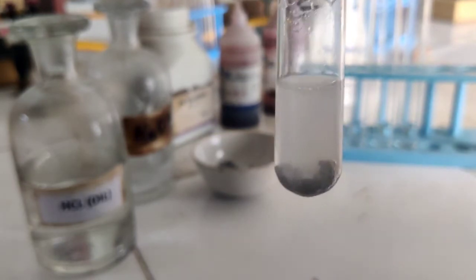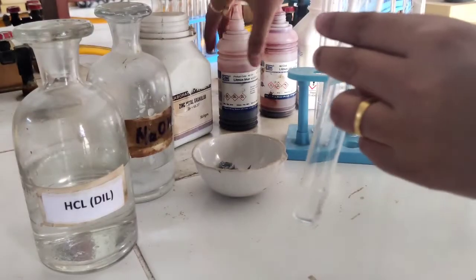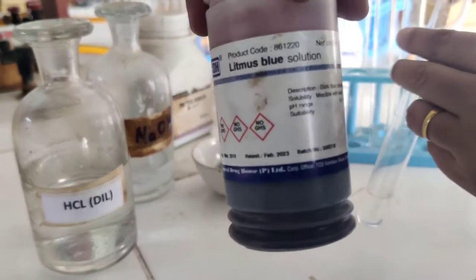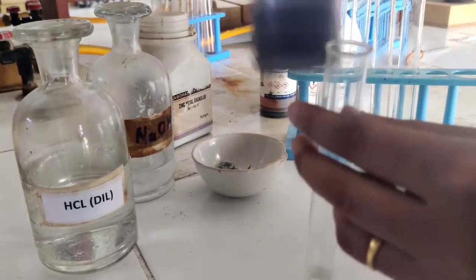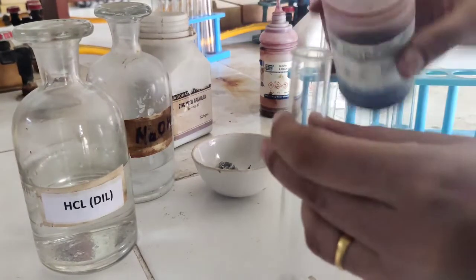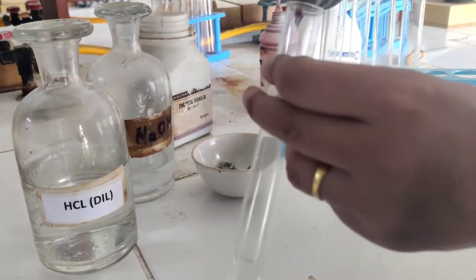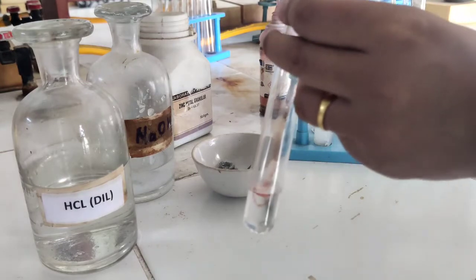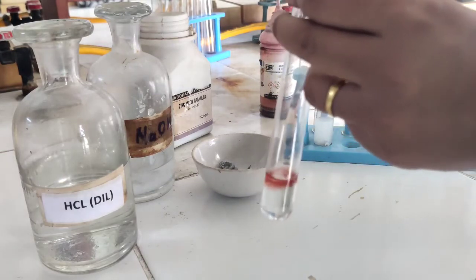So the first reaction — reaction of zinc metal with dilute HCl — produces hydrogen gas. In the next experiment, we will take the blue litmus and add it into HCl. Because HCl is an acid, it will turn blue litmus red.